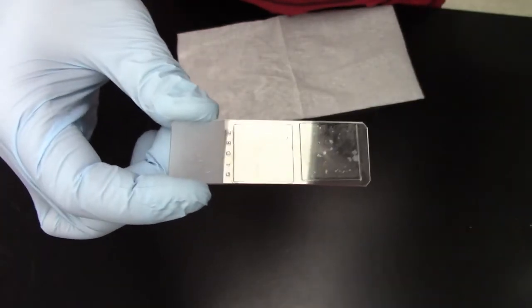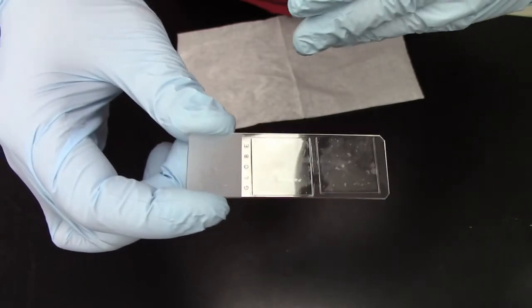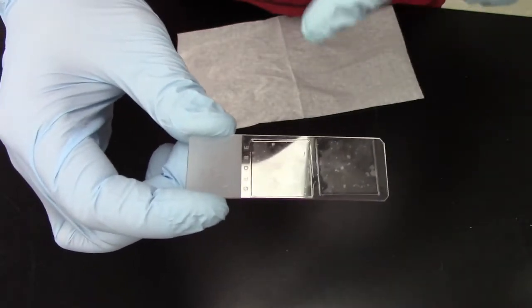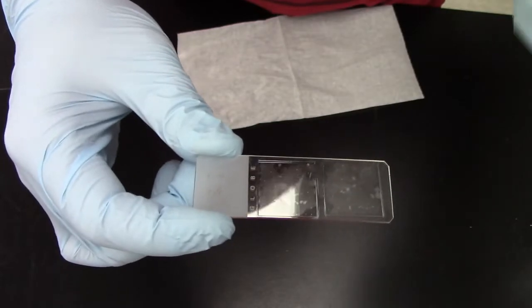So if you were to submerge this slide right now in some alcohol or in water, these coverslips would actually come off. So this is not something we are going to do.